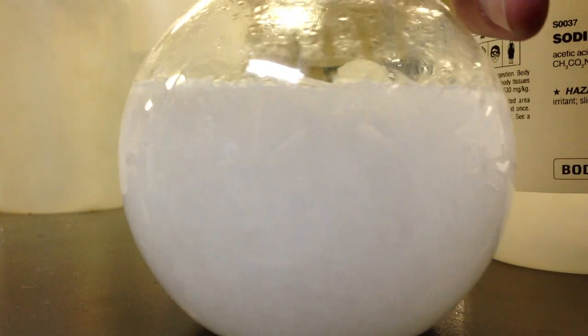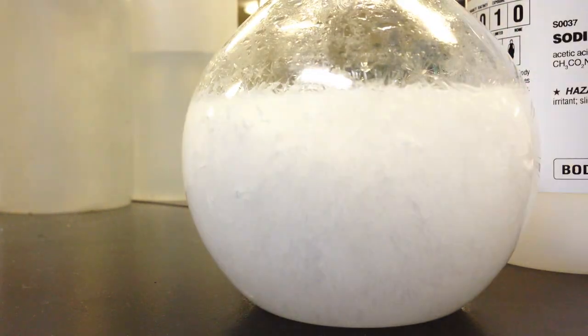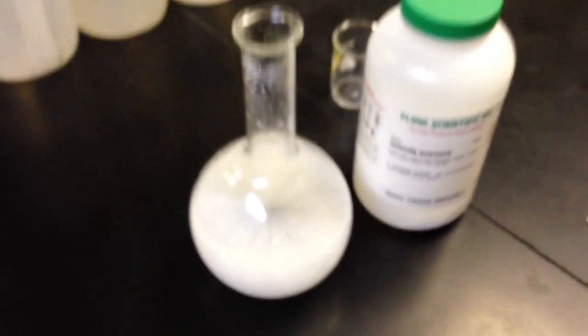So now we're back. There's a little bit of water in there. You might be able to see it. But we're back to our saturated state right now. So we've gone from supersaturated to saturated in just a couple of seconds.